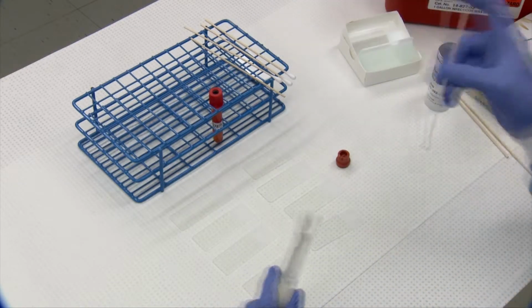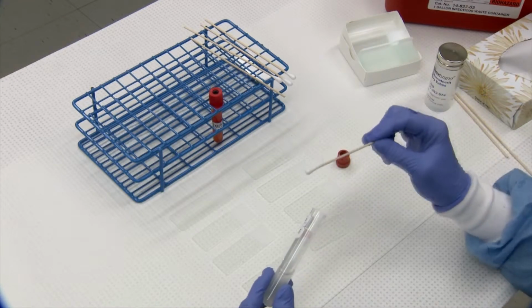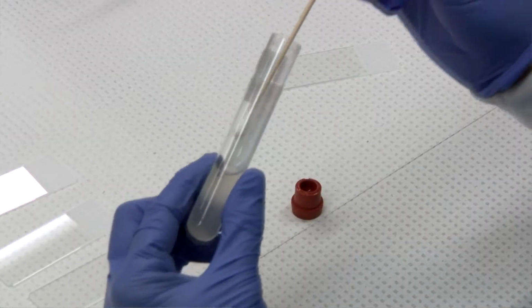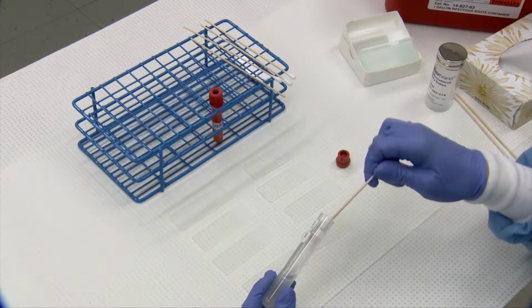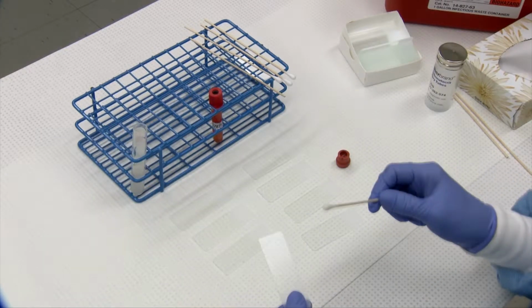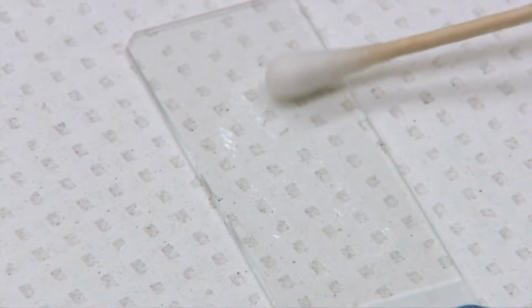The best way to capture particulate matter, if it's mucus, a clot, piece of fibrin, any and all of those can contain cells, which can be very important for diagnosis. Take an applicator Q-tip and just swish it around in the fluid, trying to capture material as best you can. Take it onto a slide, and above the frosted edge, just gently smear it out, and you'll be able to see your material on there. So that's your swabbed sample.